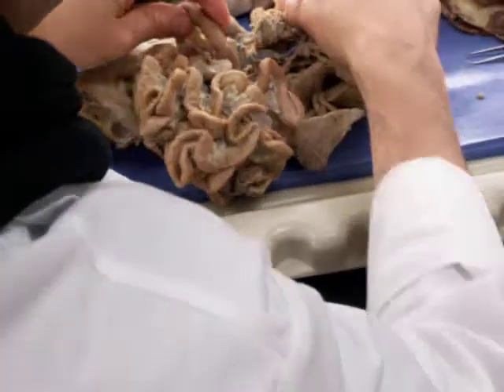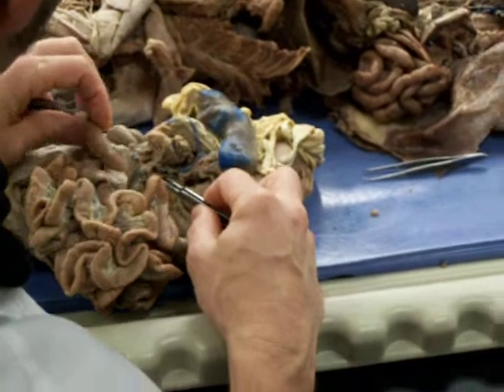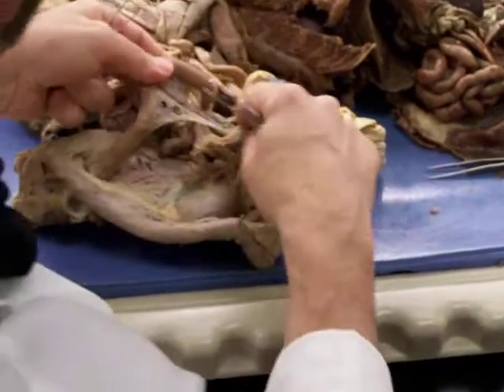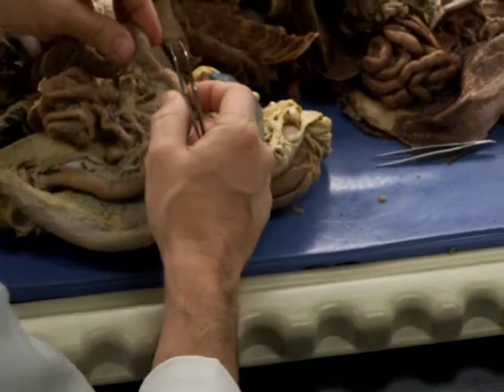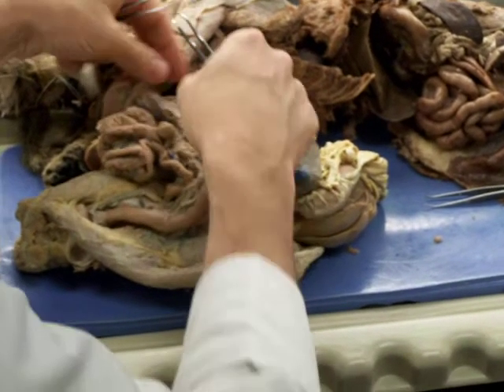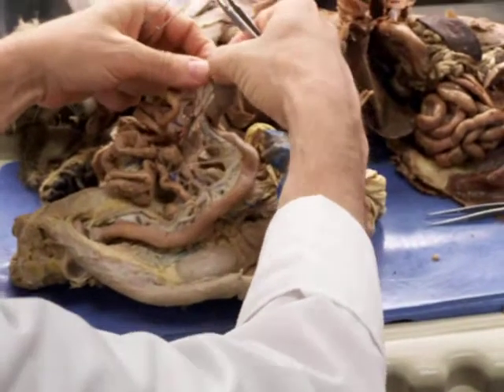The next one to come off is the cranial mesenteric, or superior mesenteric. And if we kind of get these guys sorted out a little, so we've got the colon running down here, and that comes from the ileum, the last segment of the small intestine, which starts right here. Here's the cecum of the colon.